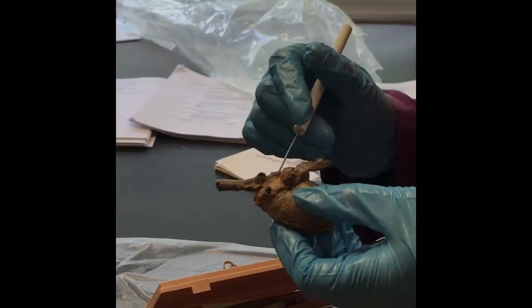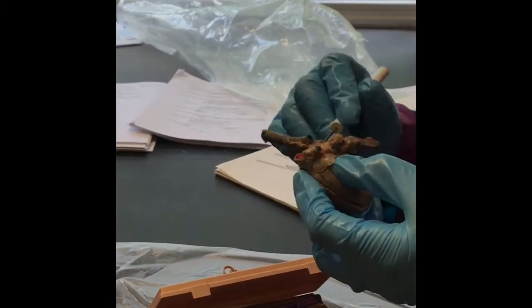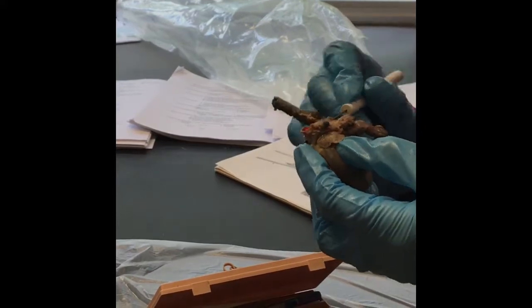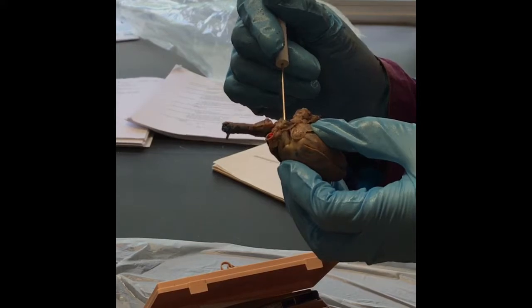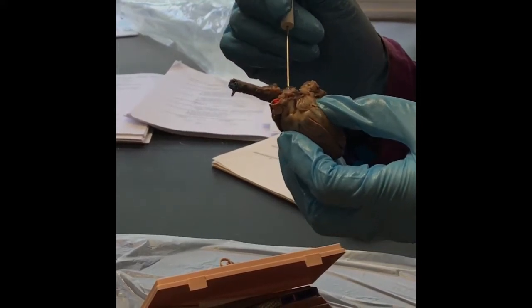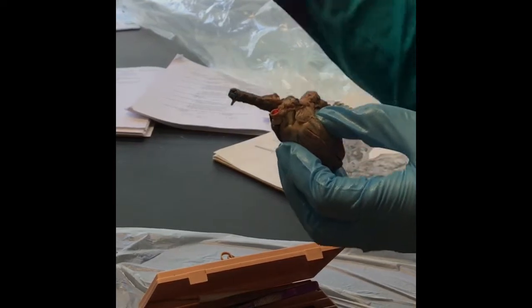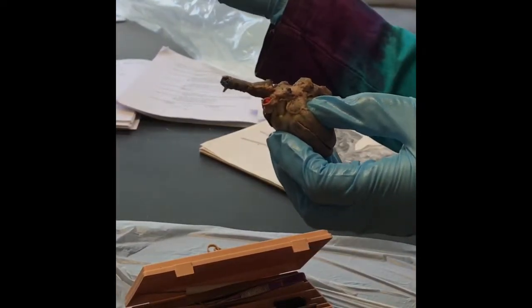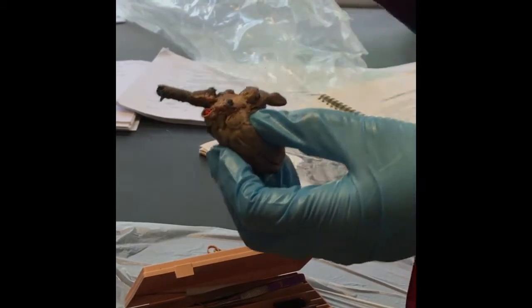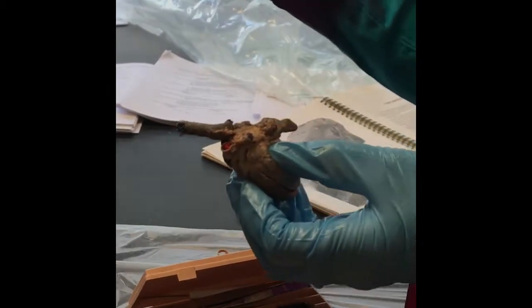Right here is a pulmonary artery. So if I keep doing this, this is the trunk, and I have a right pulmonary artery, and there's the left pulmonary artery. Those are going out to the lungs to pick up oxygen. The only arteries to carry deoxygenated blood are pulmonary arteries. In the lungs, it is picking up oxygen.